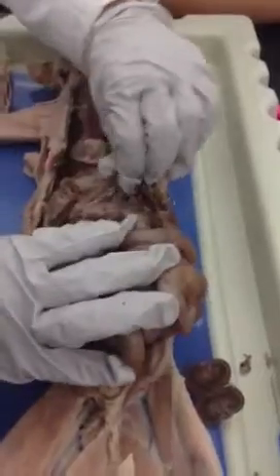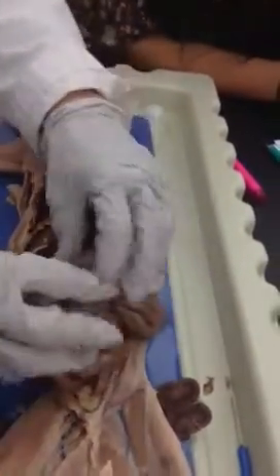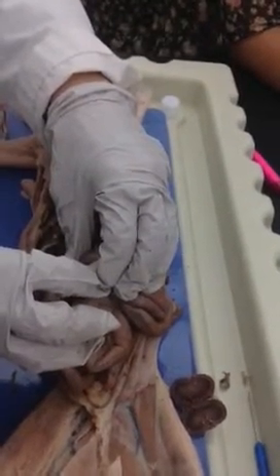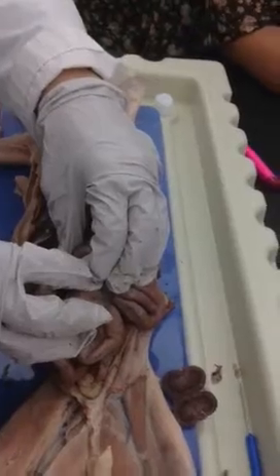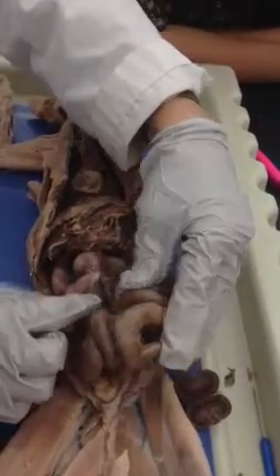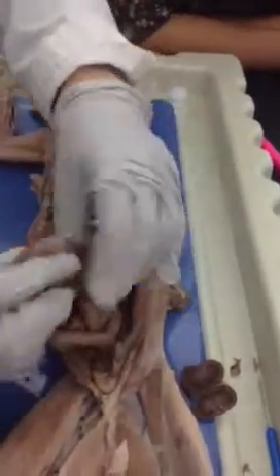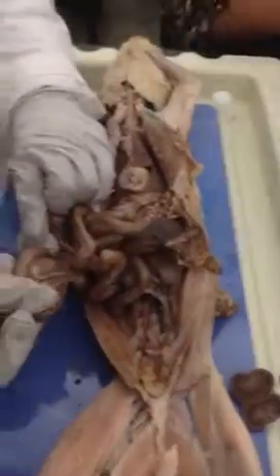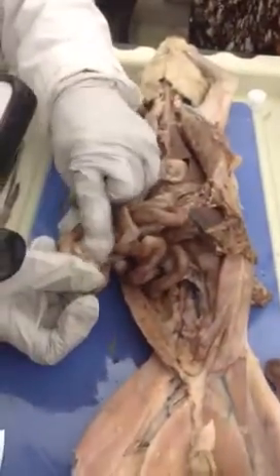Okay. For the small intestine, we're going to come off the stomach. And the first part's going to be the duodenum. Okay, all this out here. How'd I say I was asked this in lecture? You said it. Jejunum. And then when we get to the large intestine, that part of this will be the ileum. All right, all the stuff in between, holding everything together, the mesentery.